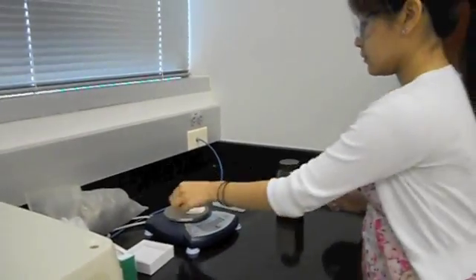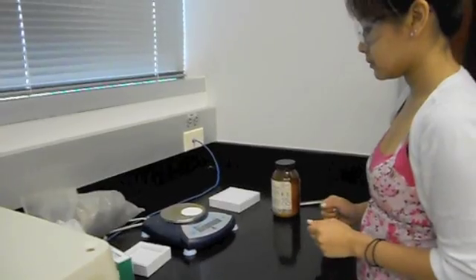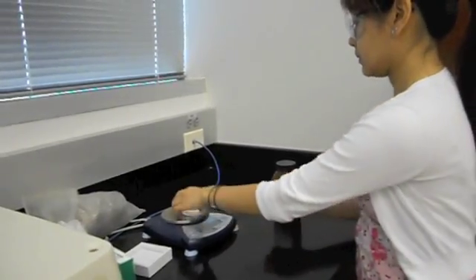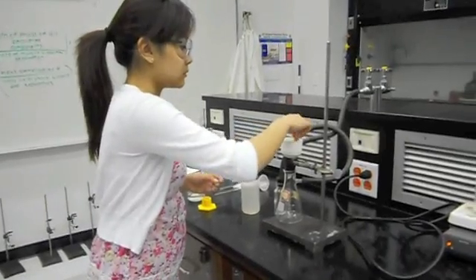Using the smaller filter paper, take the mass of it so that you can easily calculate the mass of your CaCO3 later by simply subtracting it from the total mass.